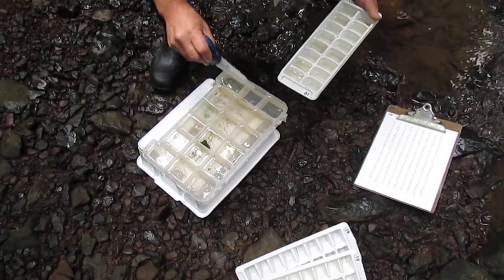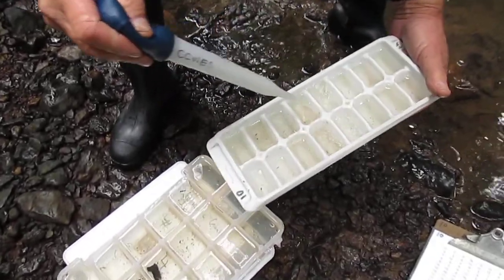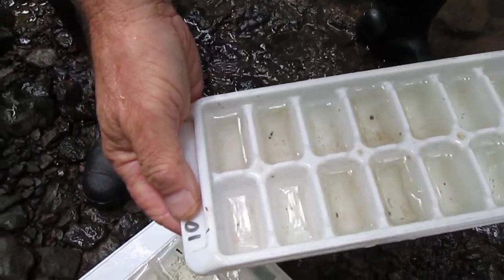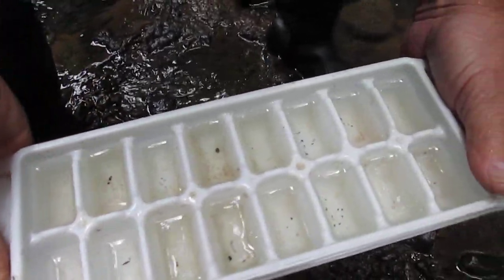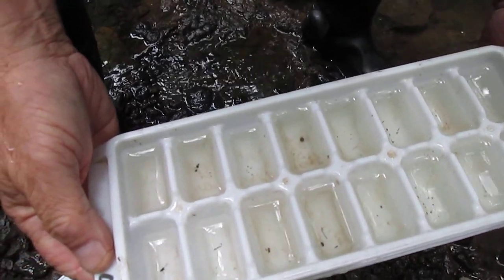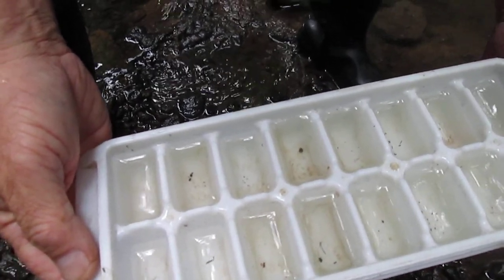Now is the time to start identifying. Using the macroinvertebrates stream ID book, you are going to find the different macroinvertebrates in the ice cube tray, separate them out, count them, and record that data on a data sheet.